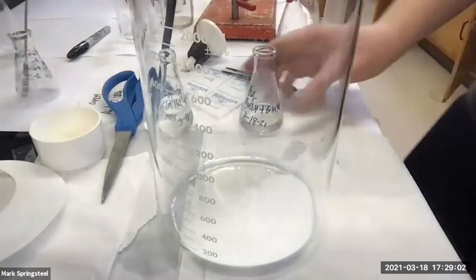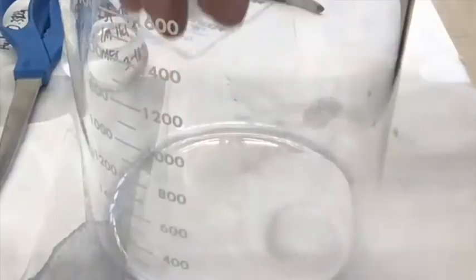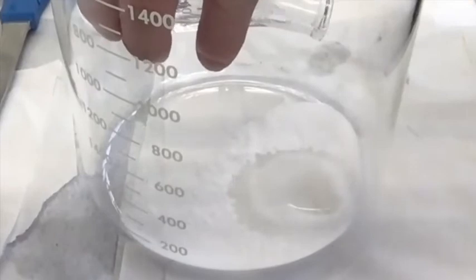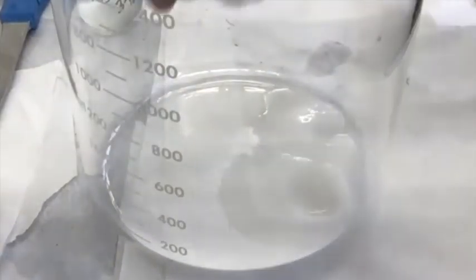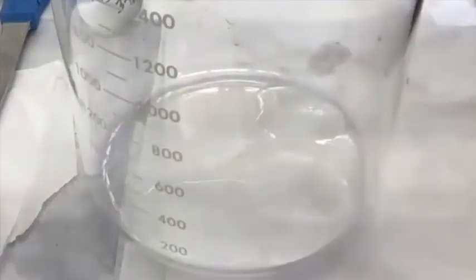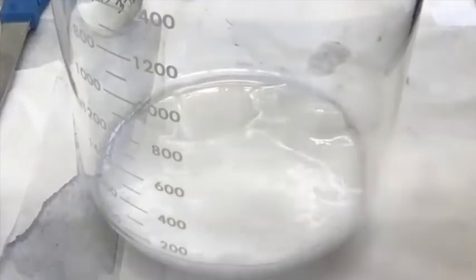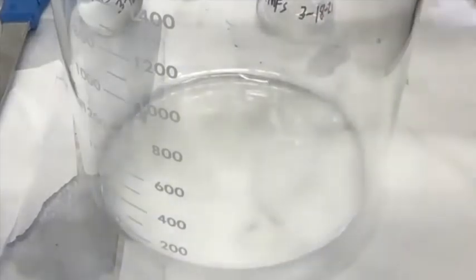And now the first one is this one. Yeah, this is a 6 molar HCl. So let's see what happens. Nice, huh? Can you see it bubbling? So the sodium bicarbonate is getting protonated and it's becoming carbonic acid, which is unstable, and it decomposes to carbon dioxide gas, bubbles, and water. So we're seeing that carbon dioxide. Yeah, and I can give this a rinse if I want to get a little more out.